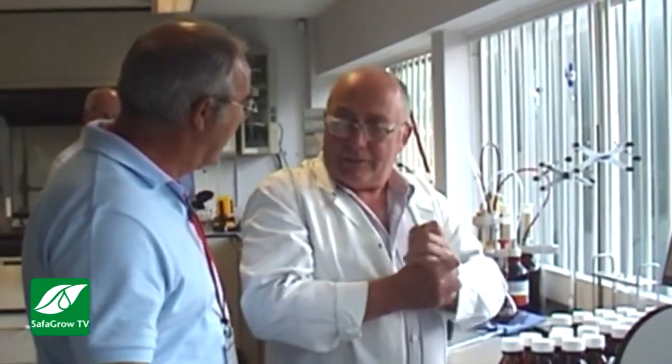It's drag. Right, okay, so it's almost like torque in a way, as an engine would. It's a complicated piece of maths, but this is at zero and that's at the speed you set, and you can determine the viscosity because of that. Okay, that's good.